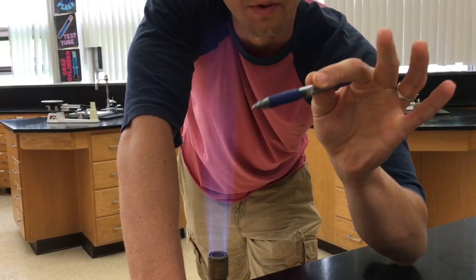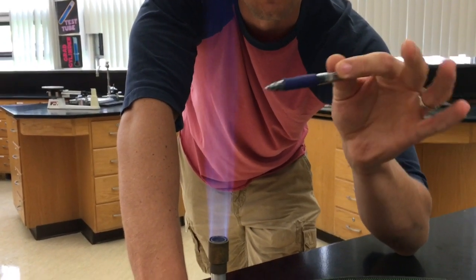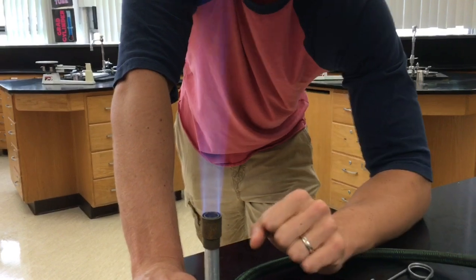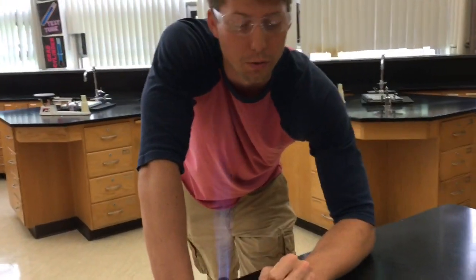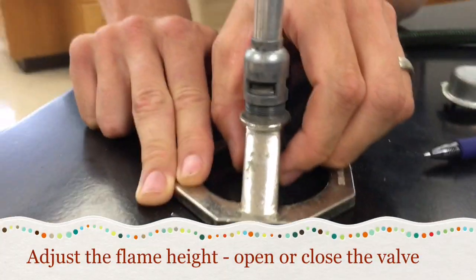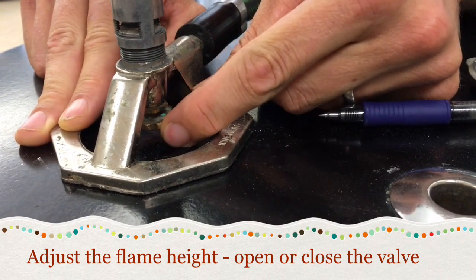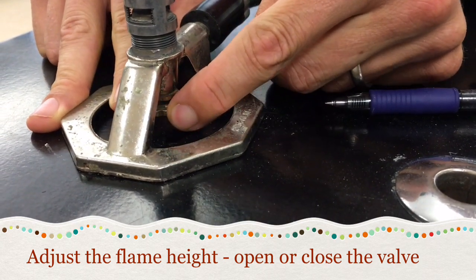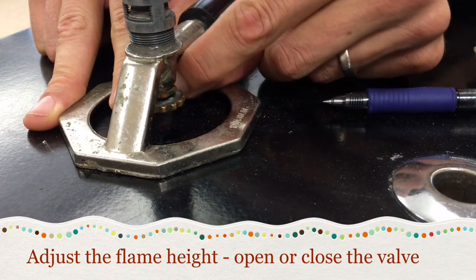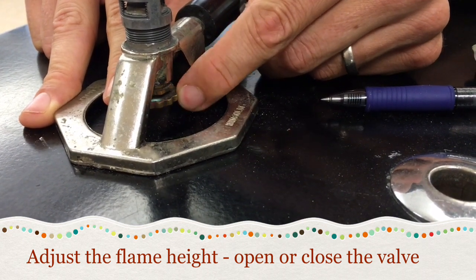That cone is going to be the hottest part of the flame — that's where we're going to want the beaker or test tube sitting right on the tip of that inner cone. I also think this flame is a little bit tall, so I'm going to make it shorter by adjusting the amount of gas coming in with the valve at the base. I can tighten or loosen it — right now I'm tightening it, decreasing the amount of gas.